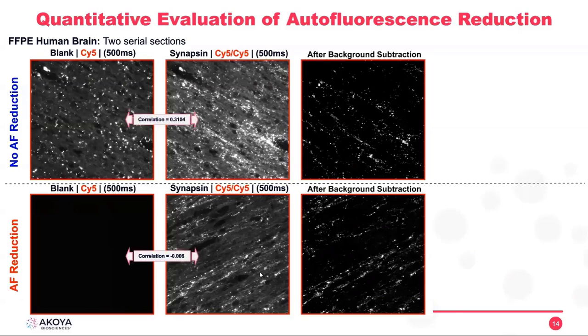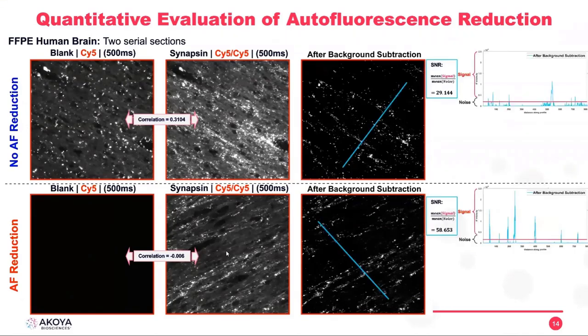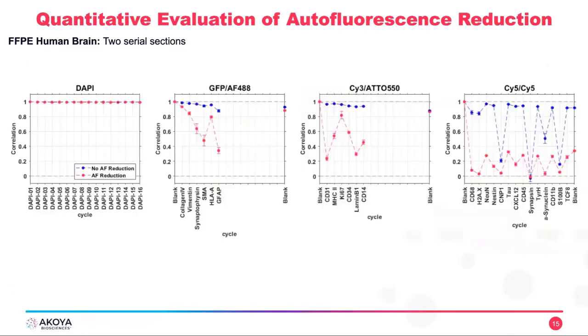And the correlation here goes from 30%, 31% to 0%. It's almost negative. And the signal to noise ratio, measured in the same way using a line profile, is 2 times bigger. And actually we can see this on all the other markers. It's very consistent across all the channels and antibodies. When we look at the second channel, third channel, fourth channel, we can see that the correlation with the background is always lower when we do autofluorescence reduction. And that's very consistent across all the antibodies.